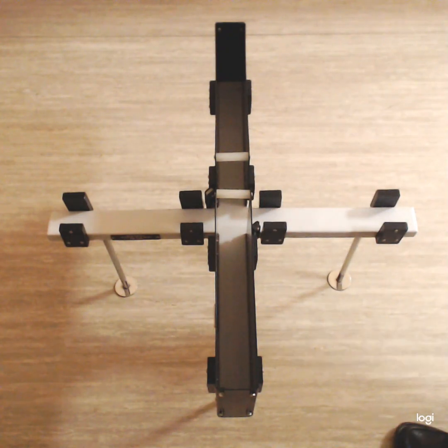So this is an apparatus called the elevated plus maze. It is used to study anxiety and anxiolytic, or you can say anxiety and anxiogenic, activities in mice. Okay, so this is designed for mice.